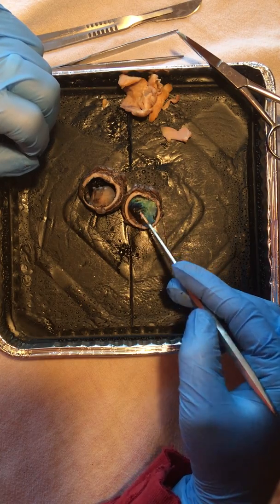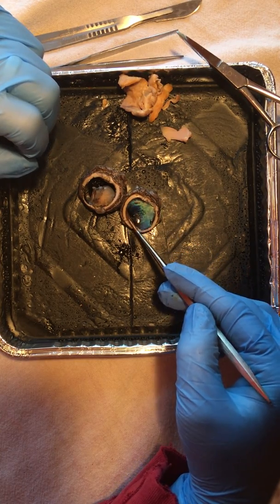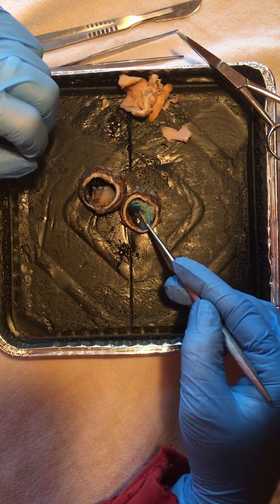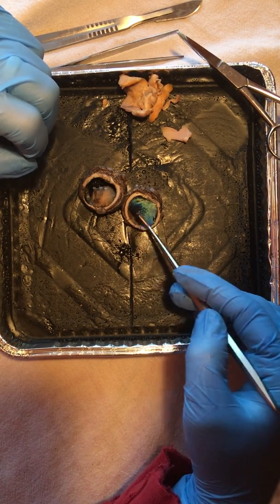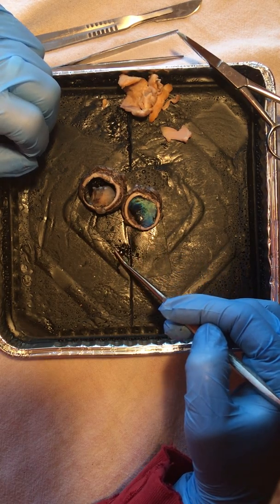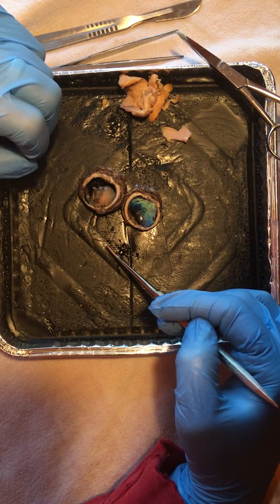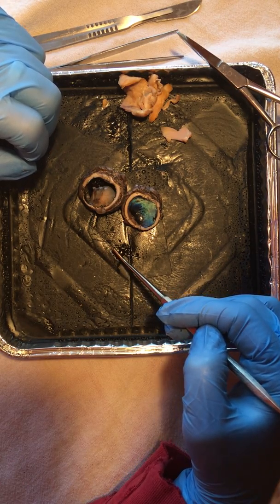And this here is known as the choroid. That's a dark sheet. You can see that layer that comes up a little bit there. That dark sheet of tissue is between the retina and the sclera, between that white portion there. And that provides a lot of nutrients for the inside of the eye and around the eye.